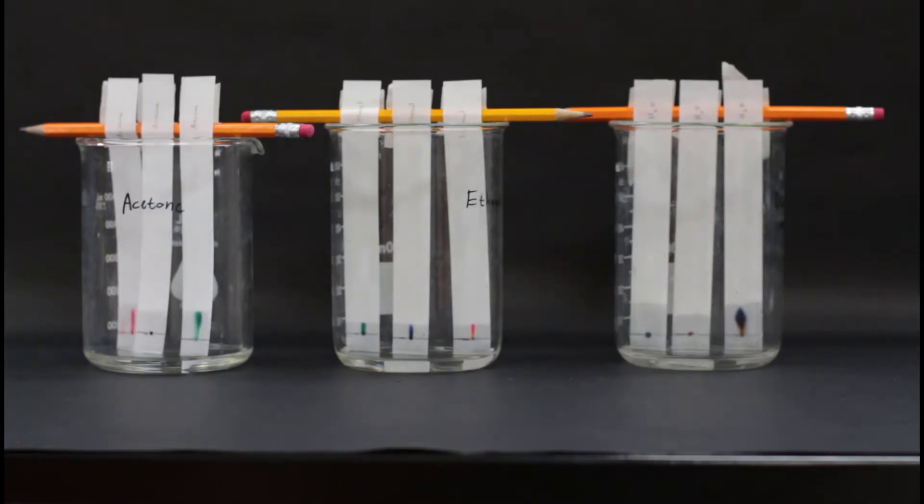In this lab, we're going to be doing paper chromatography in order to separate inks, which are actually usually a mixture of multiple pigments in order to get an exact color.